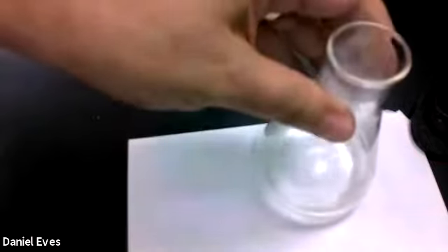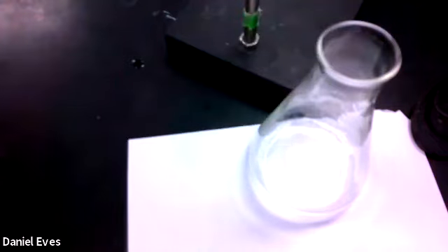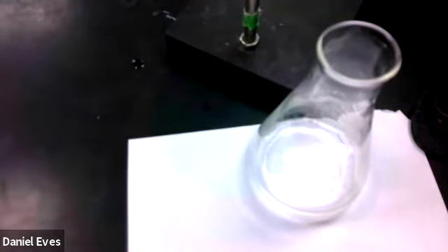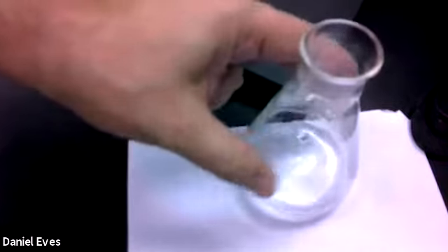Okay, for those of you who like to do a little bit more daring calculation, we're going to use a diprotic acid. So it has 2 equivalents of hydrogen for every 1 acid molecule. So we're going to go ahead and put this unknown diprotic acid here. And we're going to add our phenolphthalein. And we're going to use a burette that is starting at 0.01 milliliters of our sodium hydroxide solution, and we're going to go ahead and titrate it to find the endpoint.